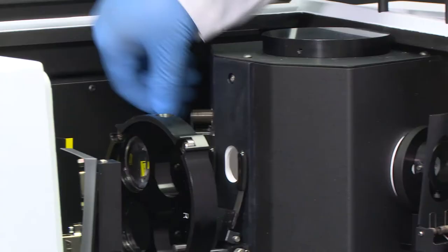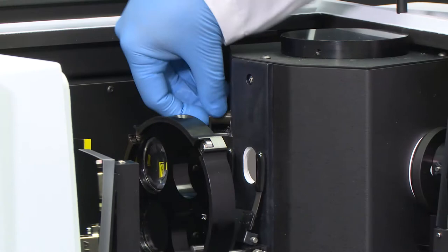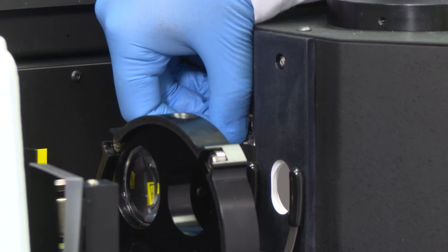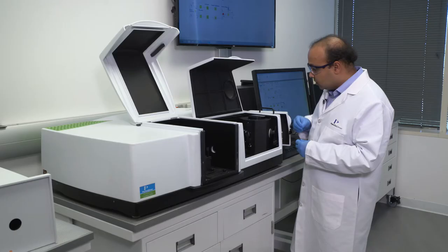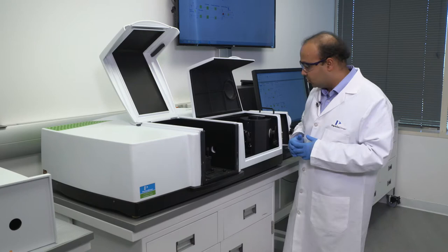We also have a specular plug here. So these are for samples that we may want to measure diffuse reflectance, the contribution of specular reflectance and so on. So I'll put a few samples here, a few dummy samples here and show you how the measurement would work.